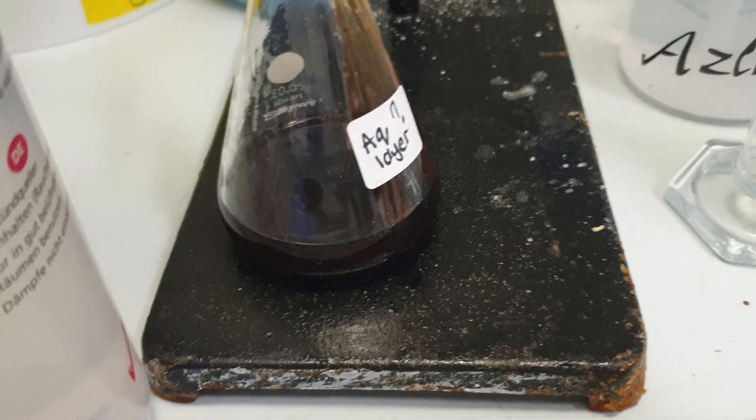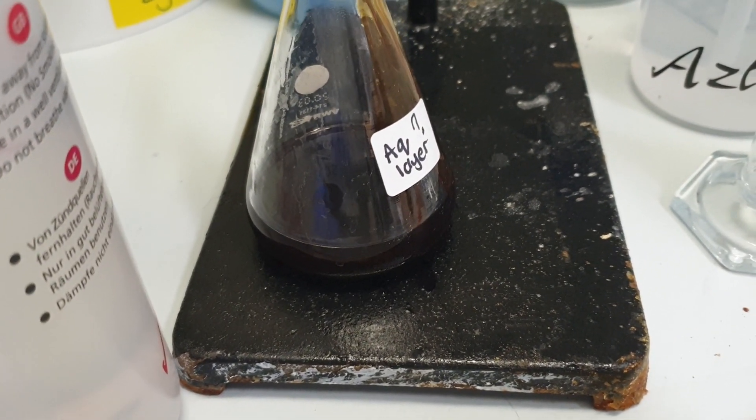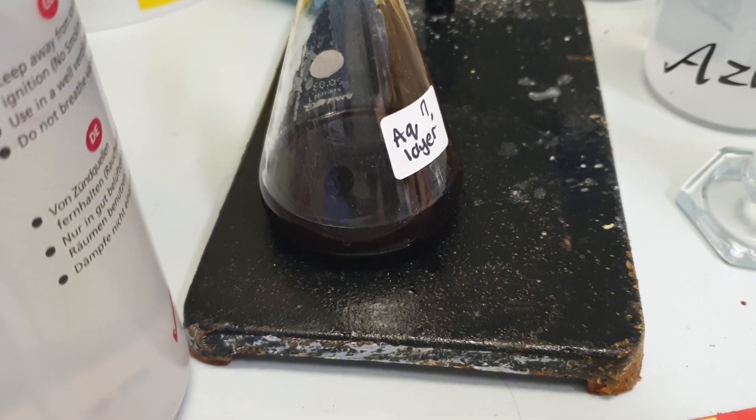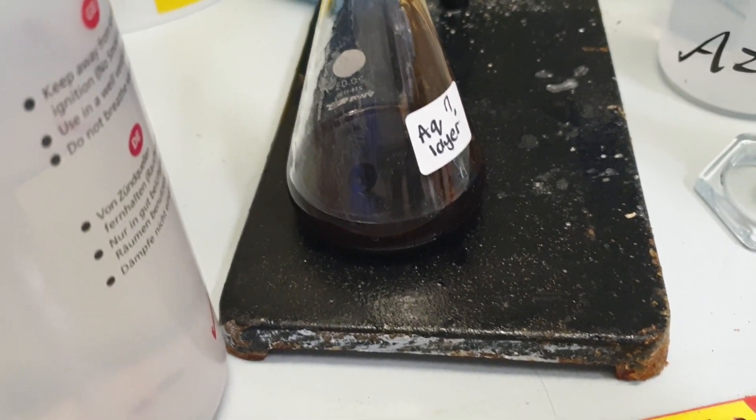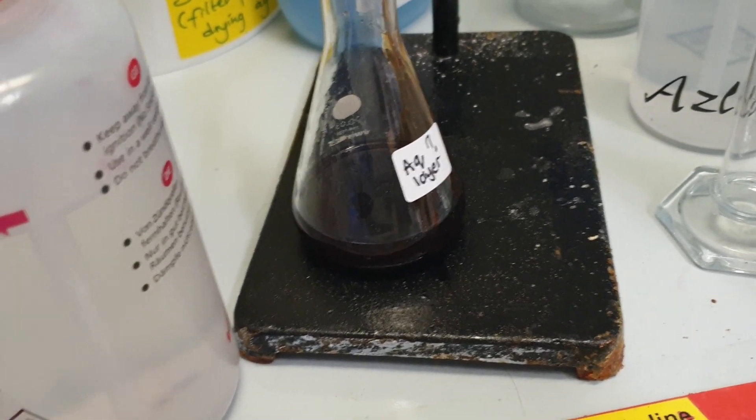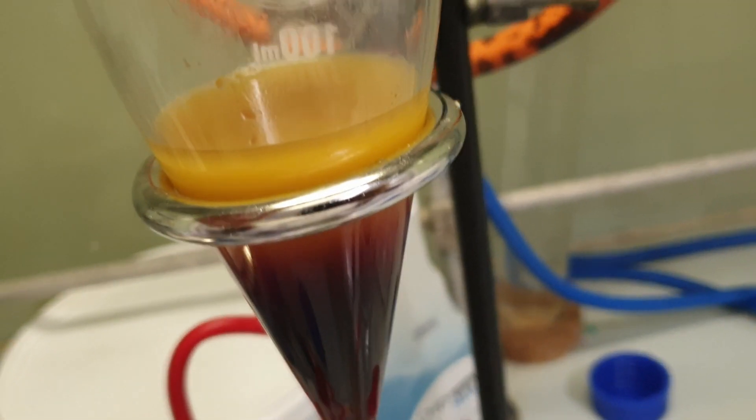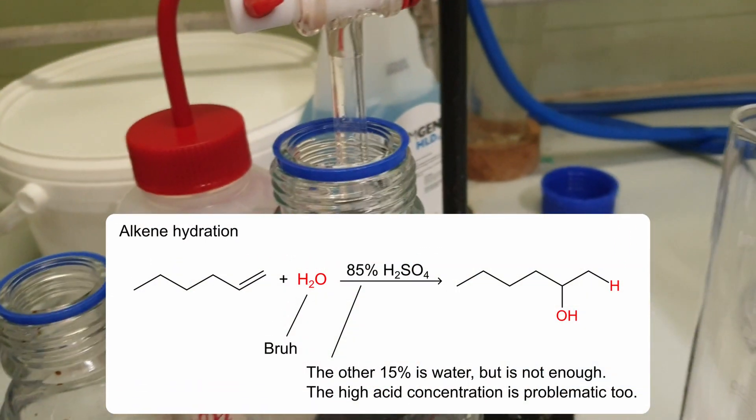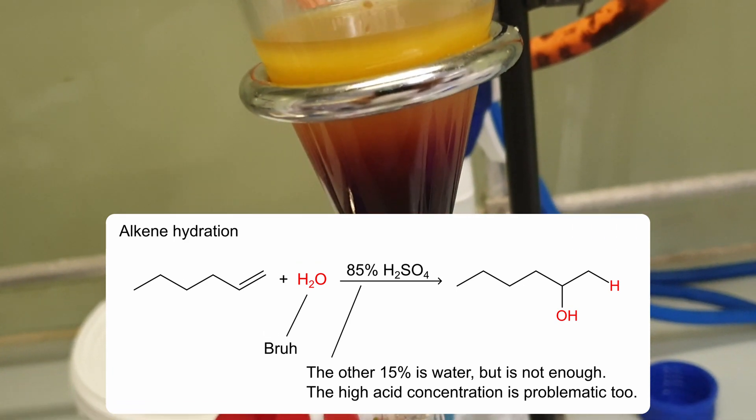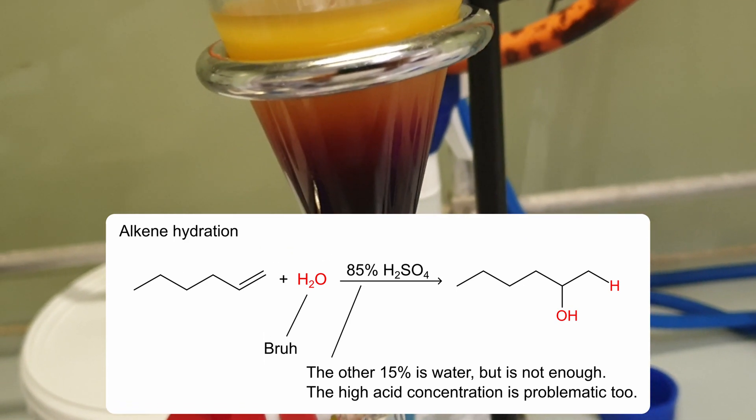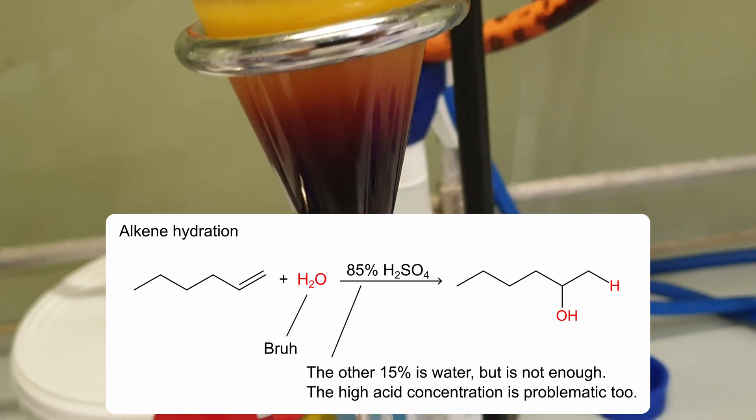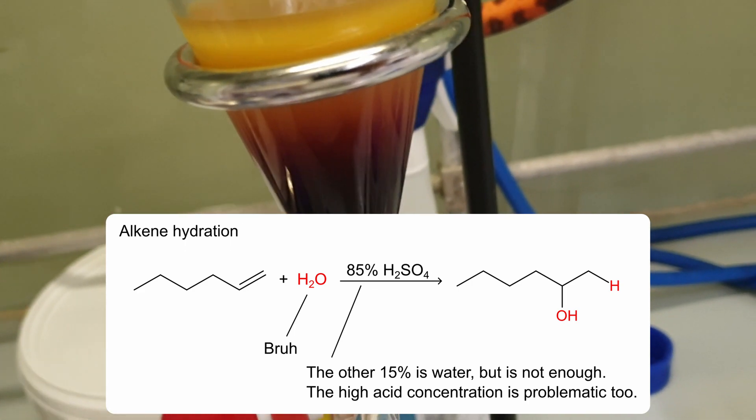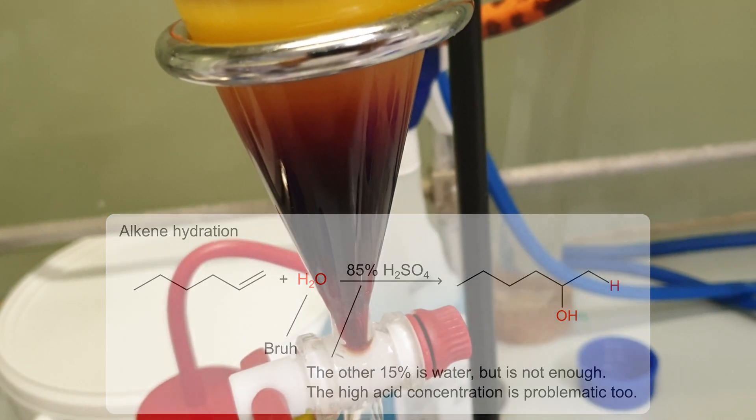The reaction mixture should have resulted in two layers, an aqueous layer and organic layer. As you can see here it's just organic or aqueous question mark. The problem is I didn't add water. I did need to add water but before extraction. Adding water would have given me two layers when the reaction was finished.